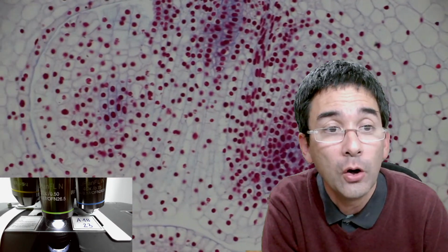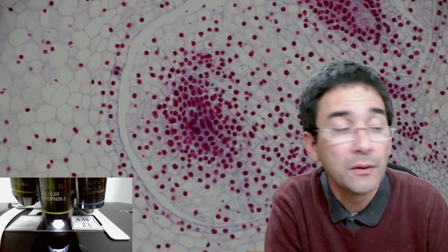I don't know what stain they used here, but if you use carmine acetate, then it will look red like this. And this is now the time when we can actually look at some of those cells in the hope of finding some that divide. I will tell you right away that there are not so many, but those that I found look actually quite nice.